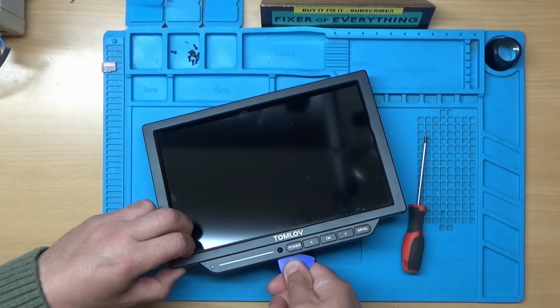And that looks like one of those iCatch chips. I think they're used a lot in dash cams. So that's a V35AX. And this must be where the battery's connected to. It looks like we've got a serial flash chip just there. I'll see some kind of power management round here. Some RAM. And I guess that's going to be a lithium battery charger IC possibly. Looks like we've got two crystals there. One will be the main crystal and the other one's probably a real-time clock crystal.